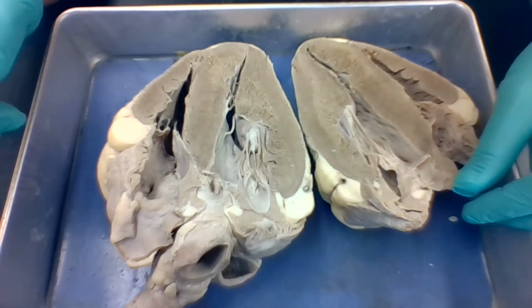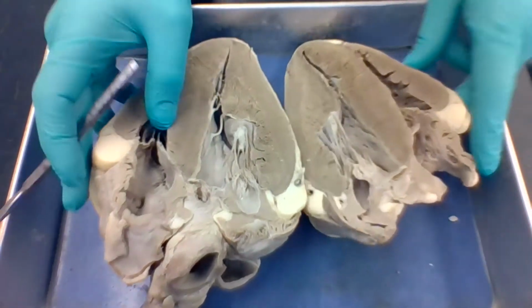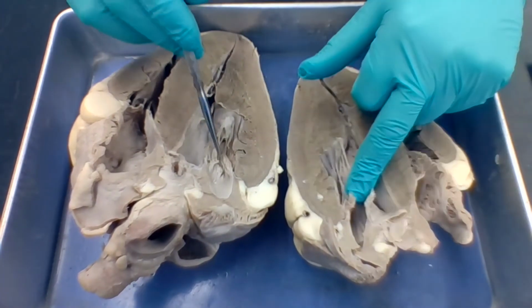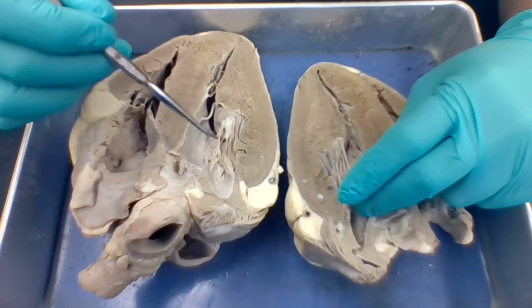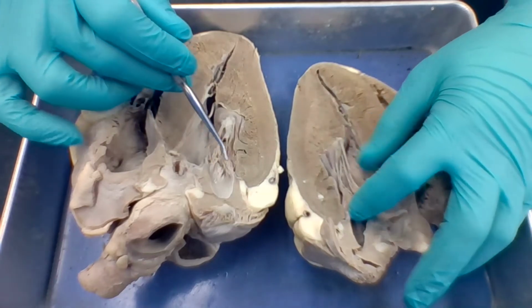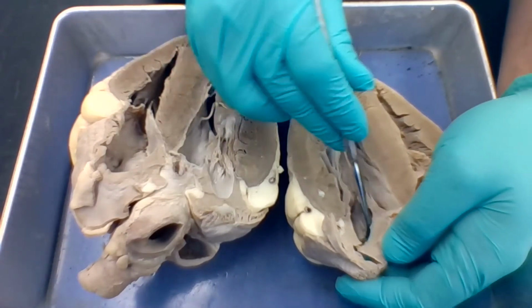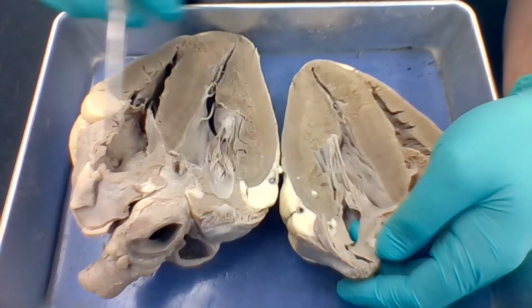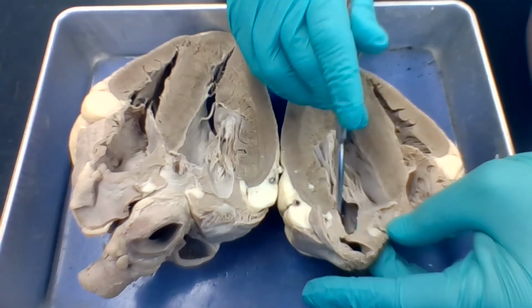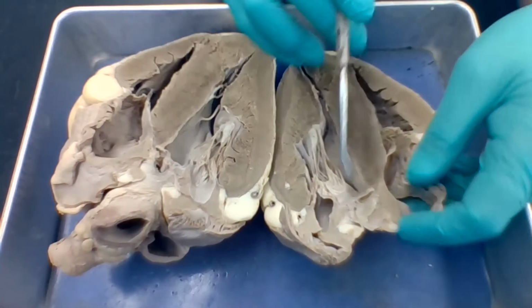Okay, so let's talk about some failures that can occur with valves. Okay, so over here, remember, we put this together. This is the right side. Here my thumbs are. This is the left side. So this is the tricuspid valve, and this is the bicuspid valve. So something that can happen is something called stenosis. So stenosis just means narrowing. So if we get a stenotic bicuspid valve, for example, narrowing, that means that there's going to be a buildup, a backup here in the left atrium. That means that the left atrium is going to have to work harder, and that means the left atrium is destined to eventually fail.